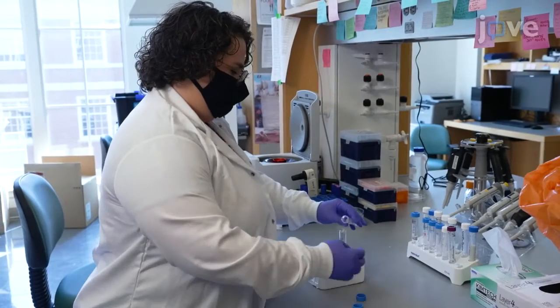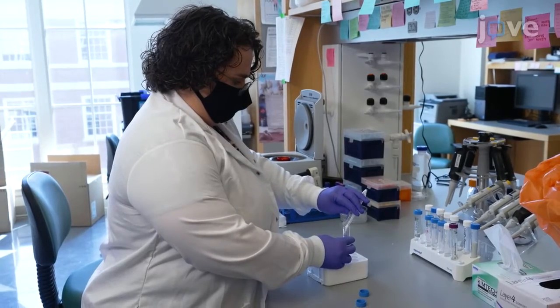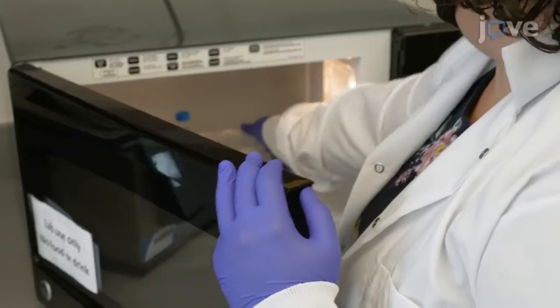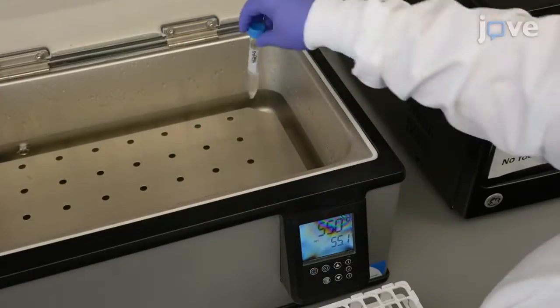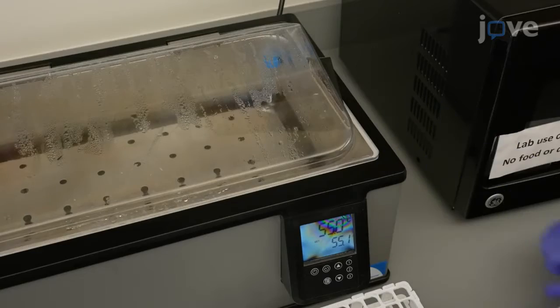To begin with, prepare the agarose pad solution by dissolving 2% low-melt agarose into marine PBS. Heat the solution briefly for about 30 seconds in the microwave, and vortex until the agarose is completely dissolved. Keep this solution in a 55 degrees Celsius water bath until ready to use.